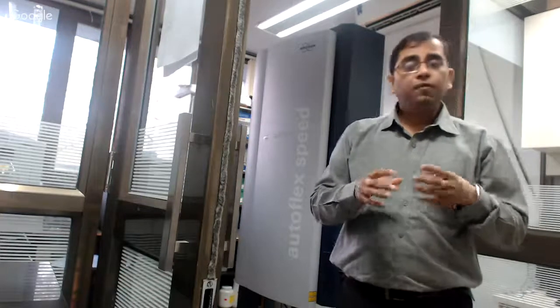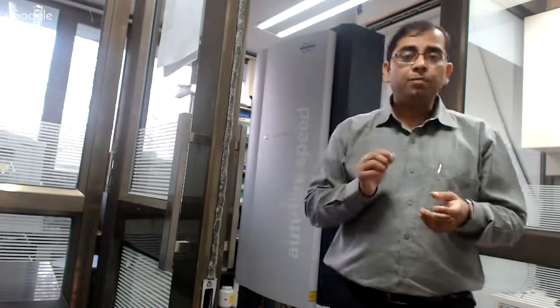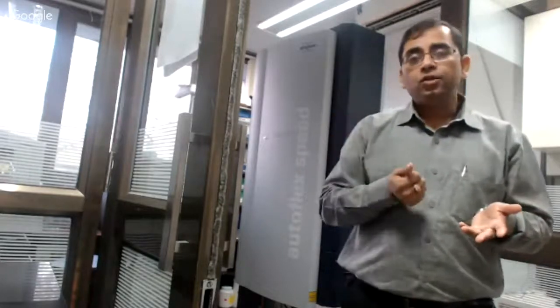For example, different types of mass spec configurations all have some value added information which you can obtain. In this case, I prefer MALDI for some very quick analysis. If I want to just know the mass of a given compound, say we have purified a protein and I just want to know the molecular weight of the purified protein. Is it matching my known or expected molecular mass? And if that is the case, then probably I'm very happy that this is right. I don't need to do anything else from any other sophisticated mass spec instruments. MALDI-TOF can do that part.